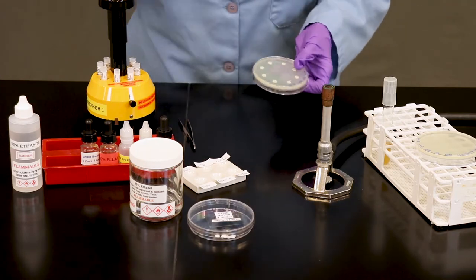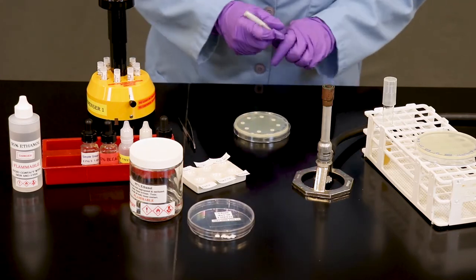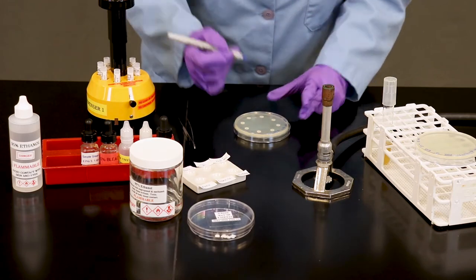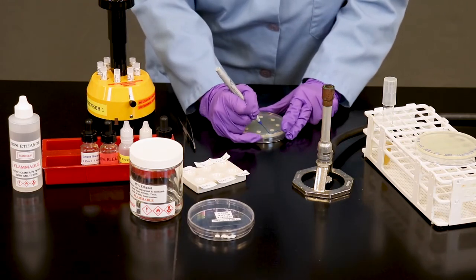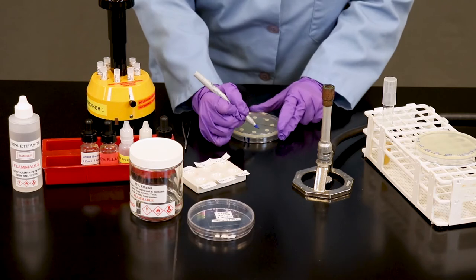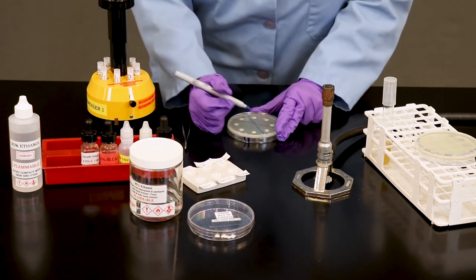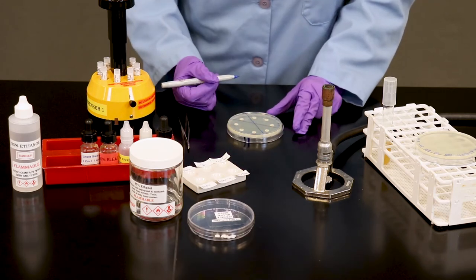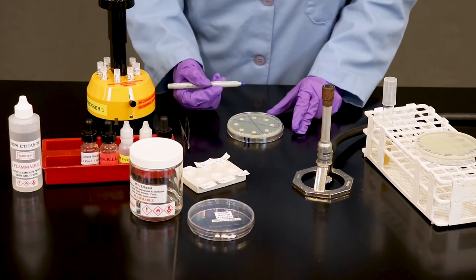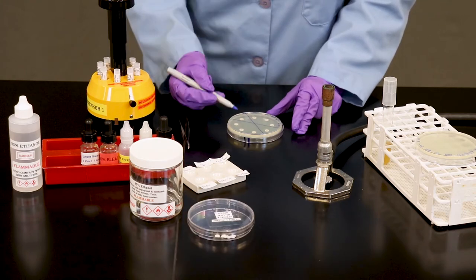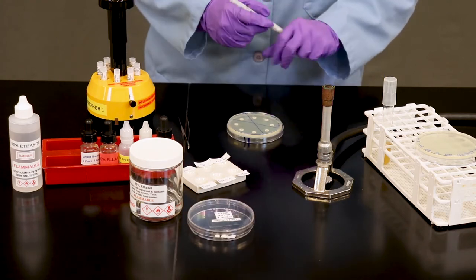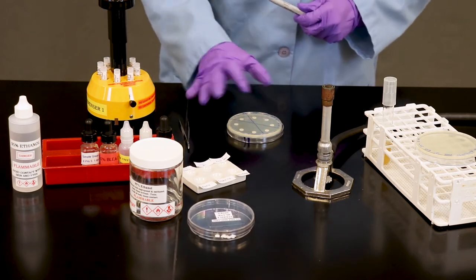You can, if you want, use a ruler or you can freehand to try your best to draw lines to indicate the different zones of the different drugs. This could help you later in class during the next period when you interpret your results. But that's simple. We are done with the antibiotic.